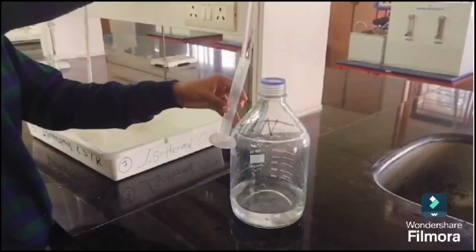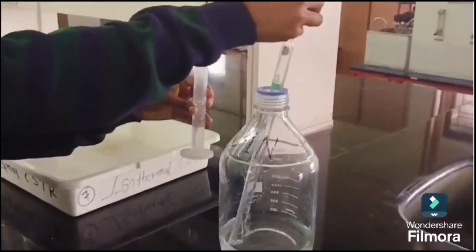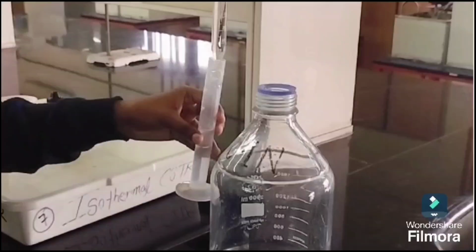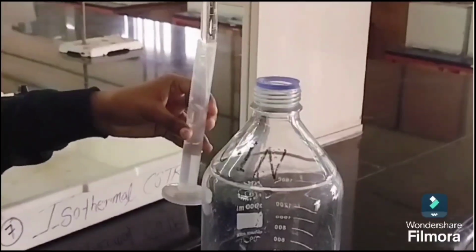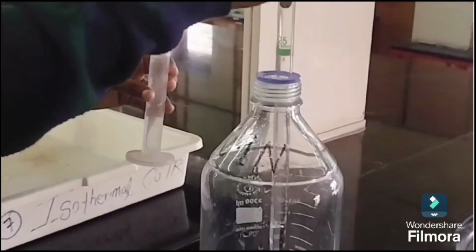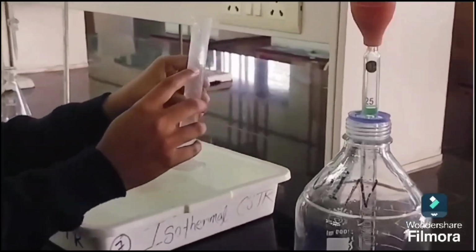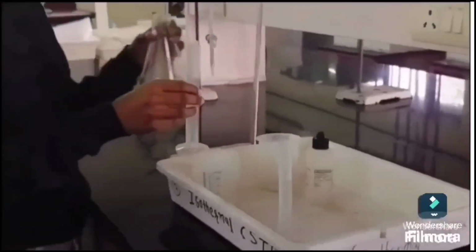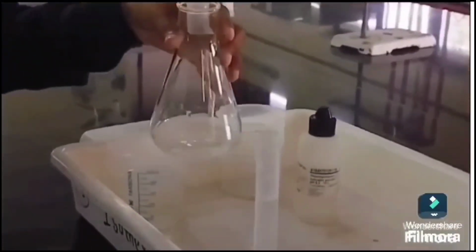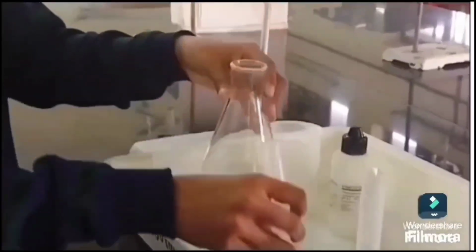And for adjusting ionic strength. In experiments involving ionic species, HCl can increase the ionic strength of the solution, which can influence reaction rates or solubility of the components. And for ensuring homogeneity, HCl might be used to dissolve reactants or intermediates, ensuring a uniform concentration throughout the reactor for consistent reaction monitoring. And for calibration or verification, in some cases, HCl addition could be part of a calibration or standardization step, helping to verify system parameters like flow rates, mixing efficiency, or reaction kinetics.